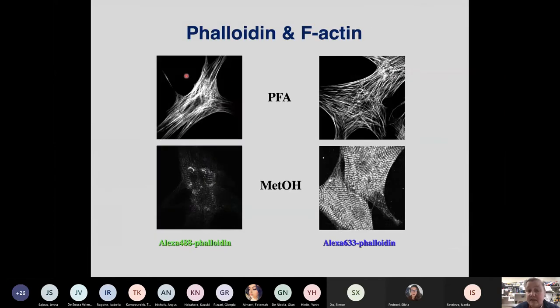Also phalloidin. Phalloidin is the fluorescence reagent for idiots, but not for methanol fixing idiots, because it will always work with paraformaldehyde, but if you methanol fix your samples, you lose the phalloidin reactivity to a different extent as well, and then you just see these residual signals and no longer the entire filamentous actin as you would have seen it otherwise.